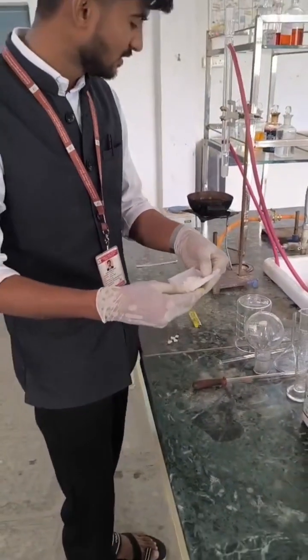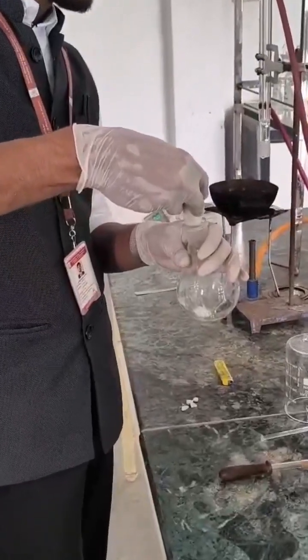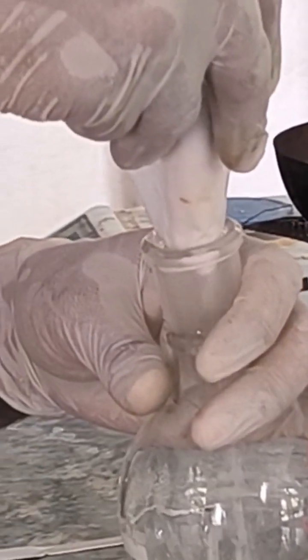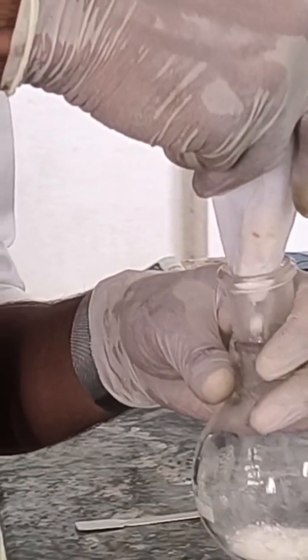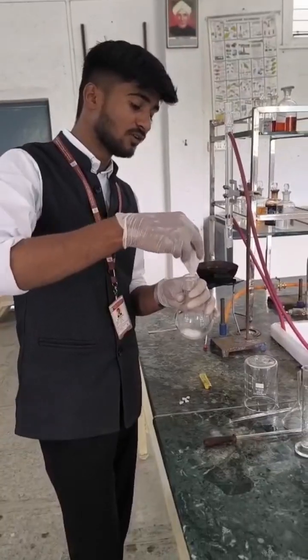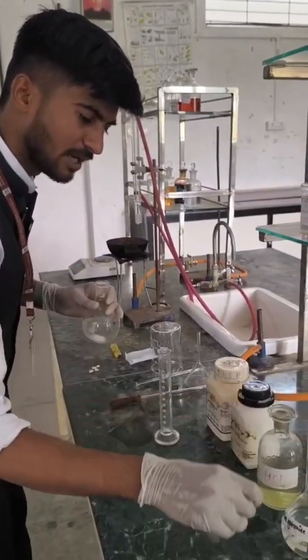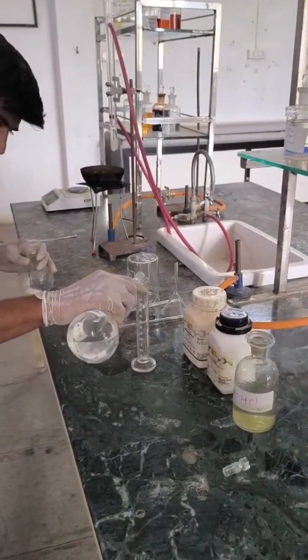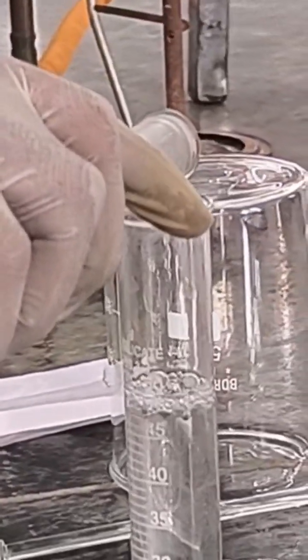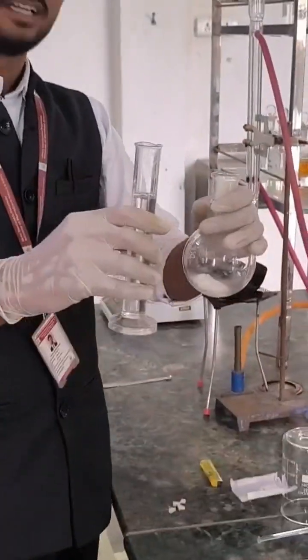Now we have to transfer this benzamide into the round bottom flask. I am properly transferring the benzamide into the round bottom flask. Then we have to take 50ml of 10% solution of sodium hydroxide. I am measuring it using a measuring cylinder, and now I am transferring this sodium hydroxide into the round bottom flask.